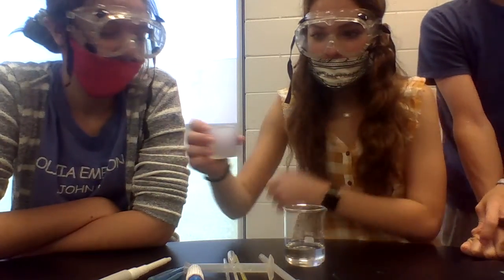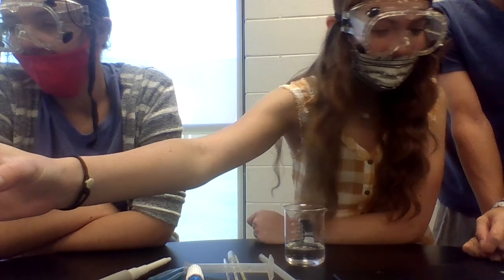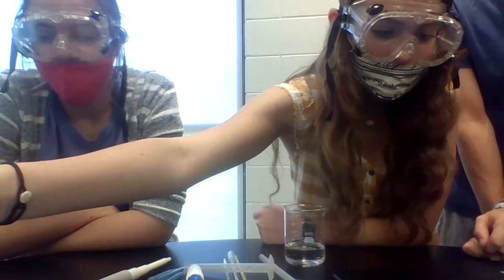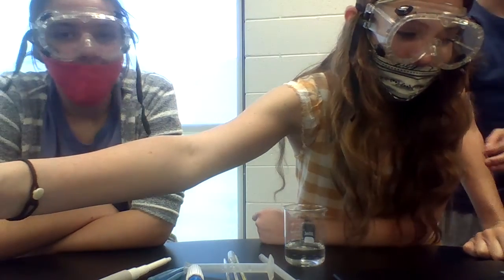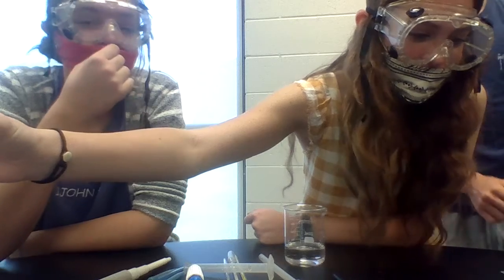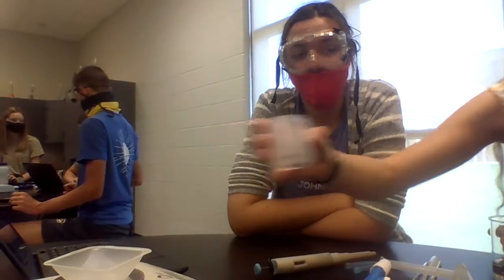Oh, she's recording. Pour it in there, or do we just set it? Yeah. We pour it in there? As long as it's tared. Why are you looking at that? Oh, you're on the Chromebook. I was so confused because I was looking at that. Wait, so we pour it in there, or do we just set this in there?